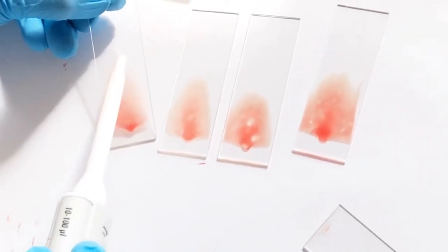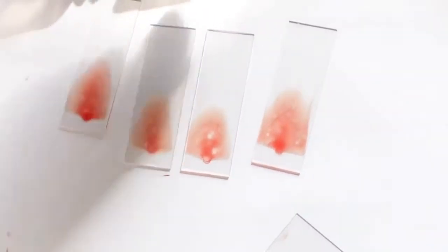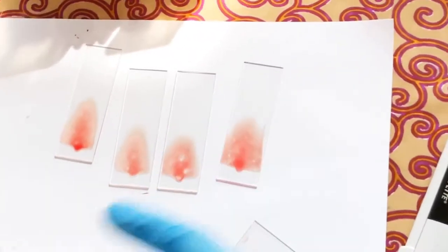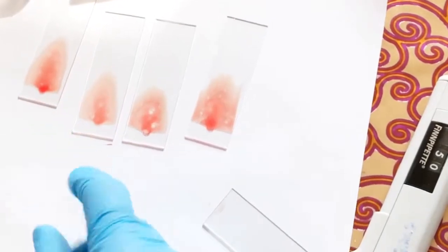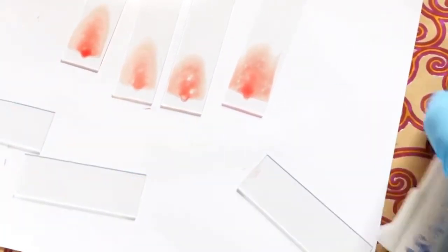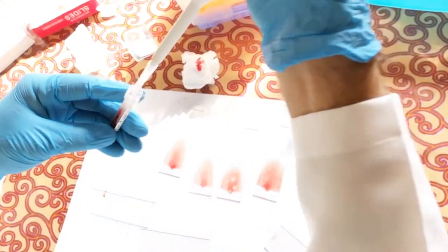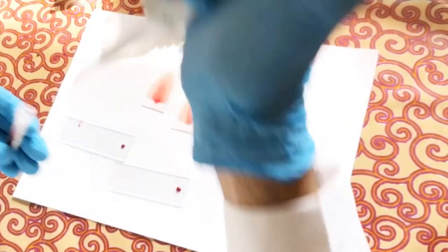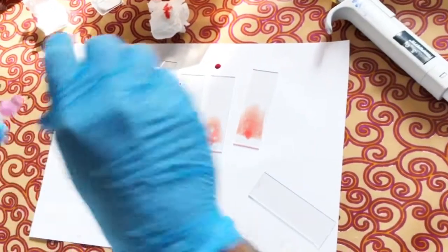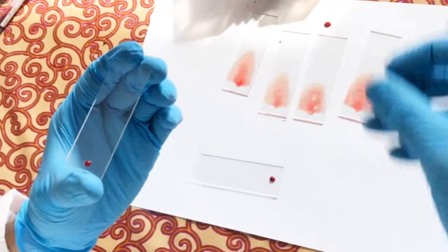On the best slide we can see the head region here, the body in the middle, and the thin tail at the end — a perfect smear. I also teach students an alternative method when they are not comfortable with the standard approach. In this alternative, I place a drop on the slide and, instead of using the edge of the spreader, I use the side of the slide and push it in a different direction.